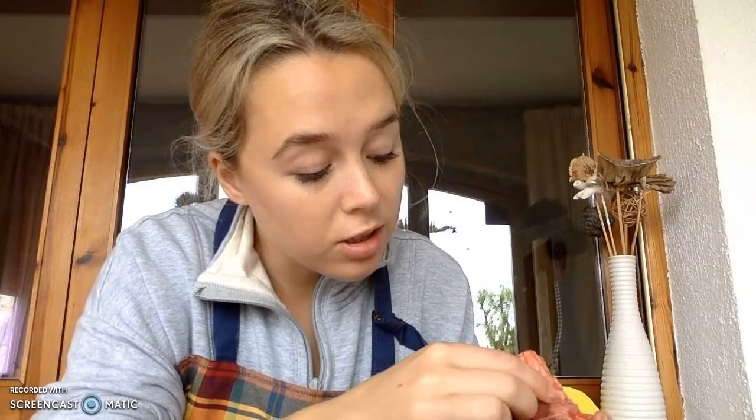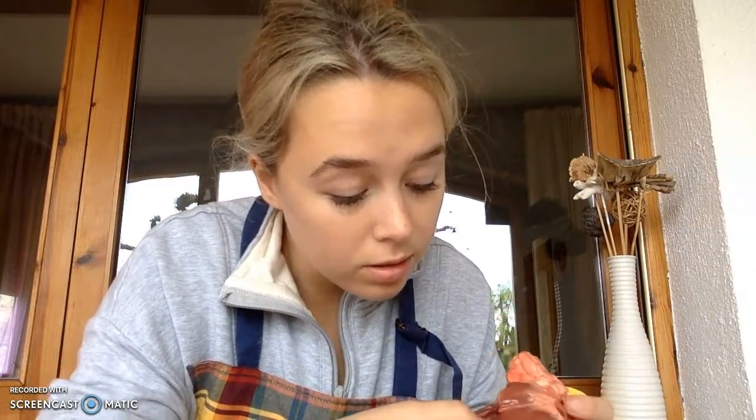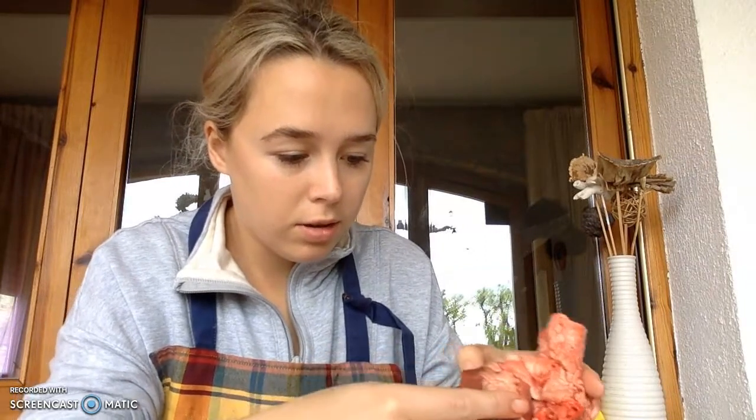Okay, so let's talk about the right side of the heart, the right ventricle. I'm going to open it up again. What you could actually see, pretty cool, is the superior vena cava, which the blood just came out of. And the inferior vena cava, which is right down here. You can kind of see that. And if we're talking about major valves, you can kind of see the chorda tendineae here again.